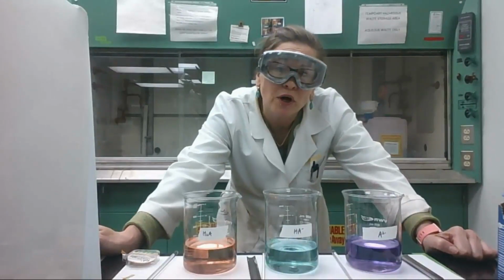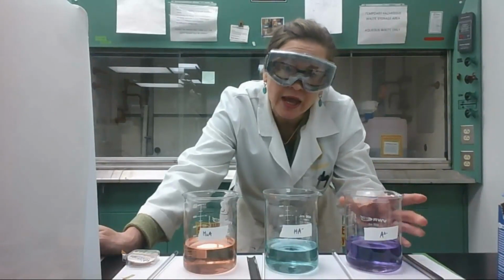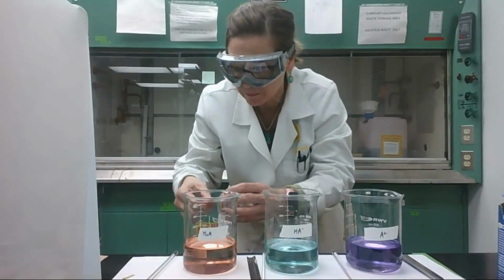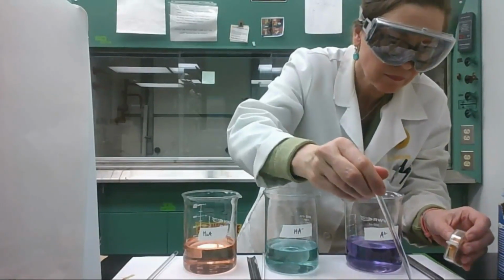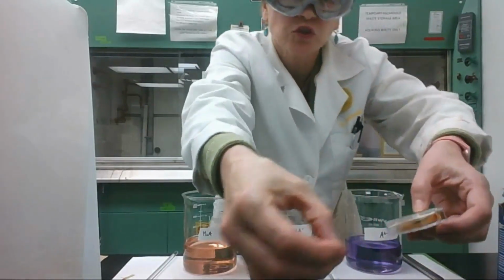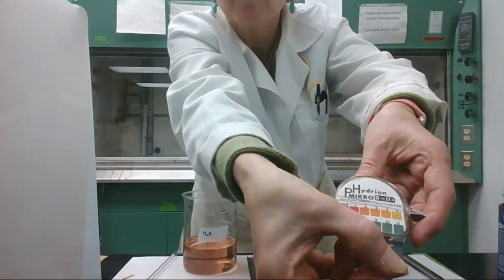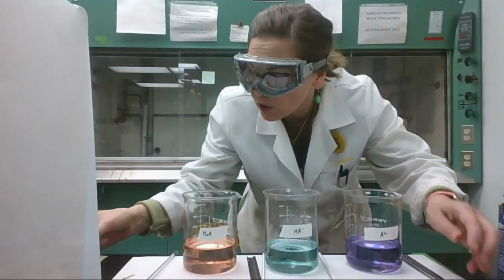Hi everyone. We're going to calculate the pH of this sodium carbonate solution, or A-2, and the color of the indicator again suggests that the pH is basic, but let me test it with pH paper and show you what I get. Ooh, that's basic. That's almost off the charts basic. I don't know if you can see that, but that is about a pH of, I would call it, over 12.